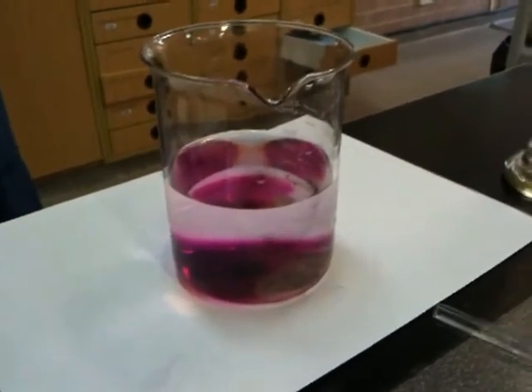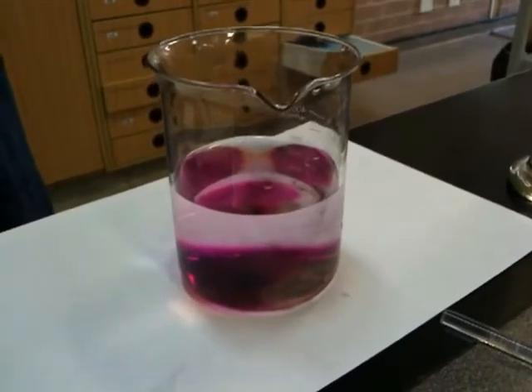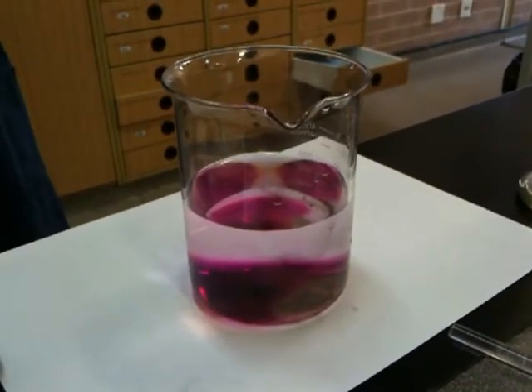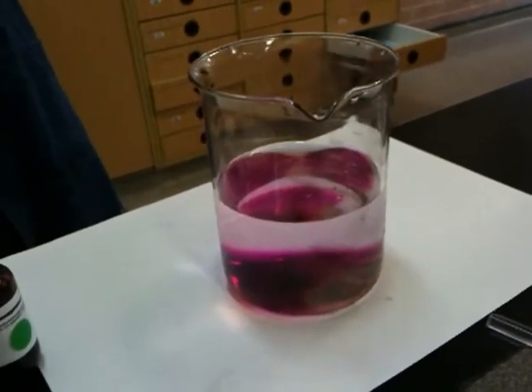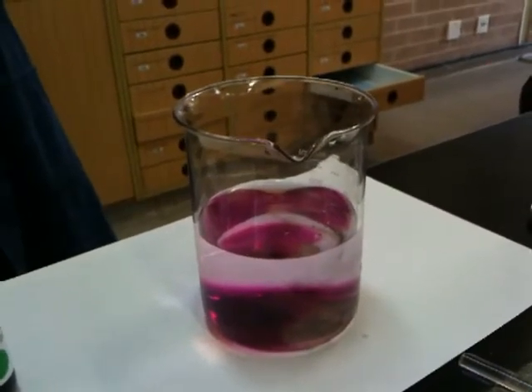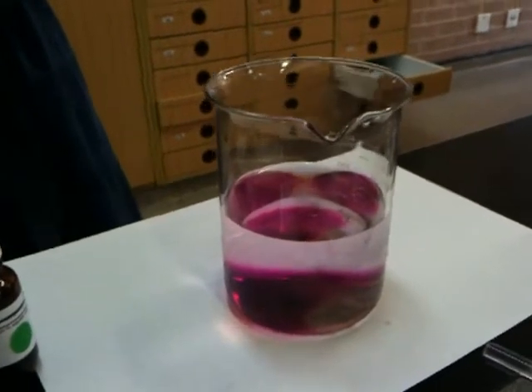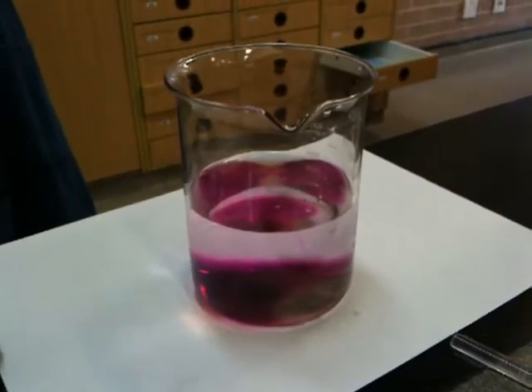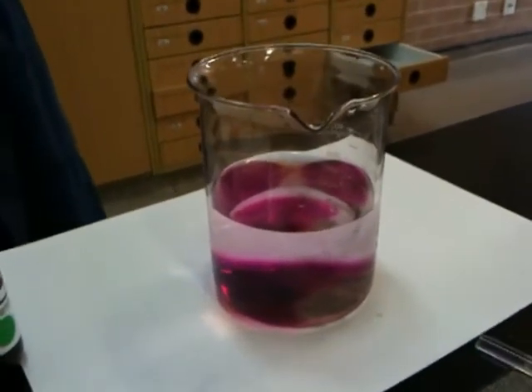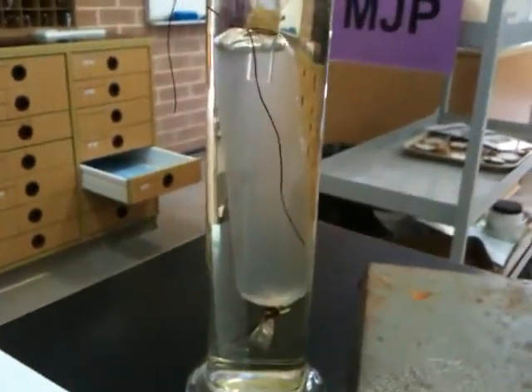Cool. And what are we trying to show here? Diffusion. Excellent. And what do you understand diffusion as? The solute is the substance being dissolved, and the solvent is the substance in which the solute dissolves. The spreading of molecules of any substance from regions of high concentration to regions of low concentration is known as diffusion. Excellent. Okay, cool. We'll have a look in about 10 more minutes whether the starch inside that bag has turned blue-black.